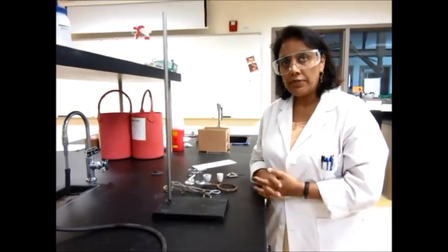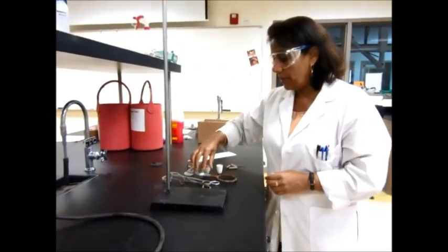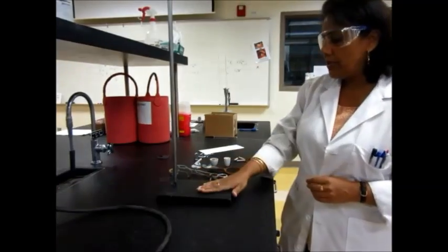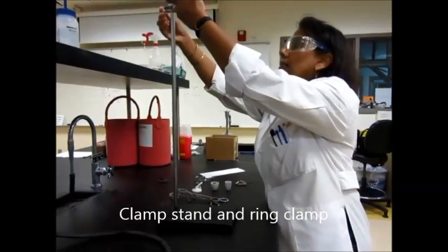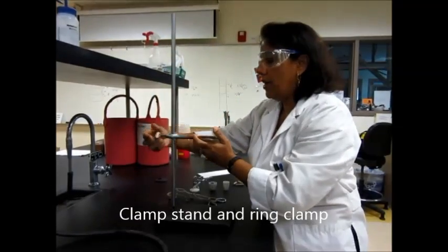In a couple of your labs you're going to have to heat a crucible, so let me show you how to set that up. You get a clamp stand and then you get a ring clamp and clamp it on here.